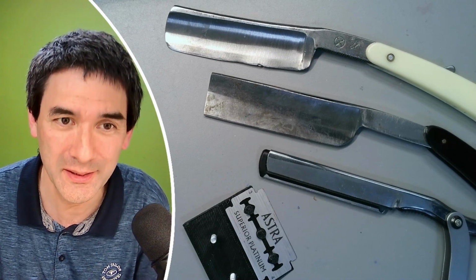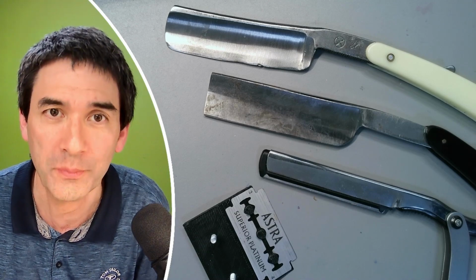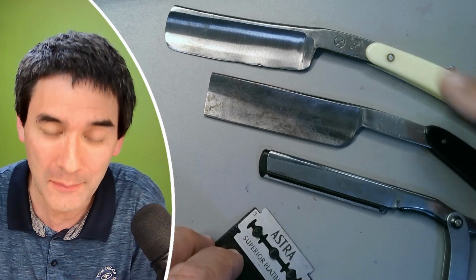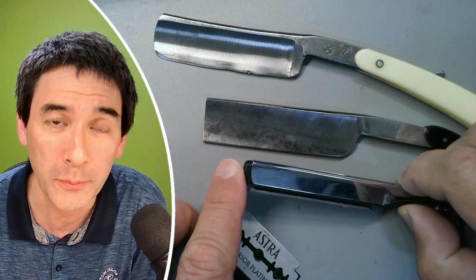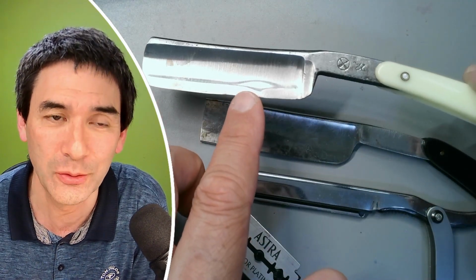I'm Oliver, and what I want to do today is test those four Microtome knives. This one over here is 3D printed, homemade. However, those here are two commercial Microtome knives, and this is a shaving knife for a barber. And I would like to test those, and as you can see, this looks pretty sad already.